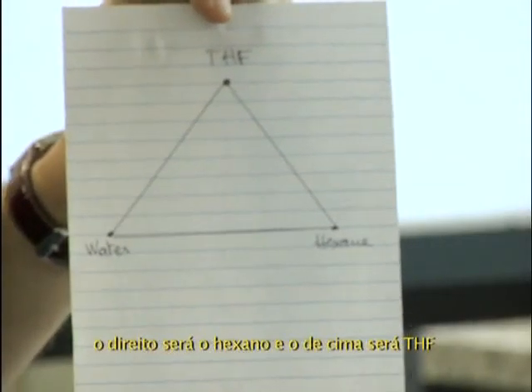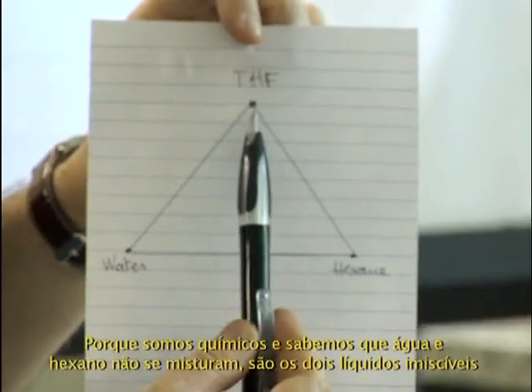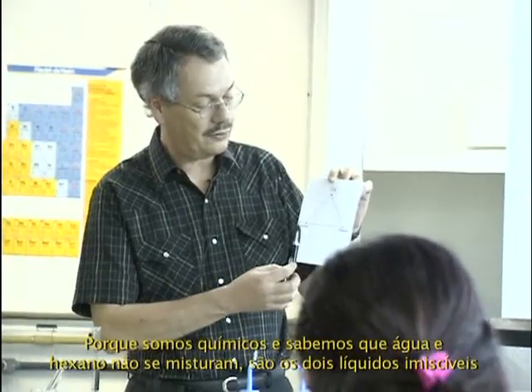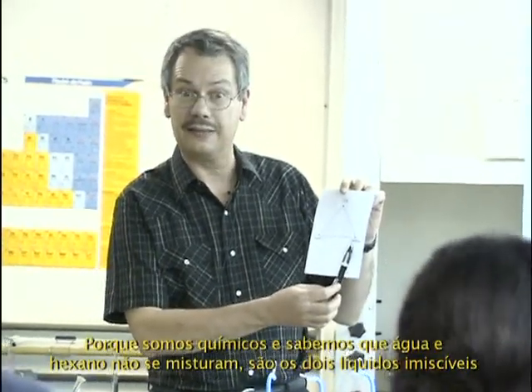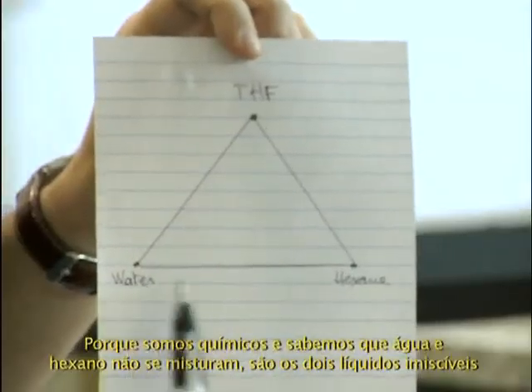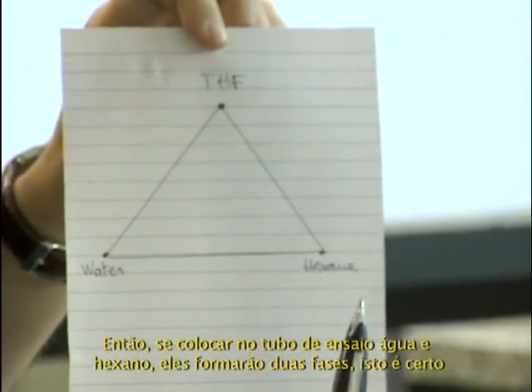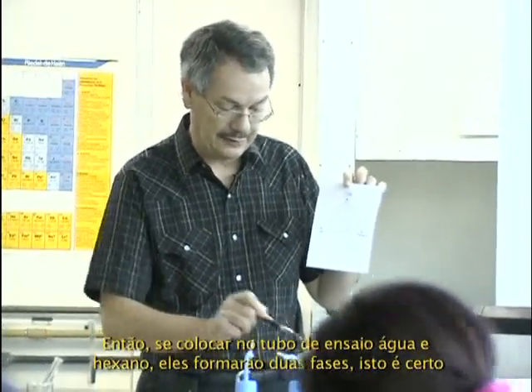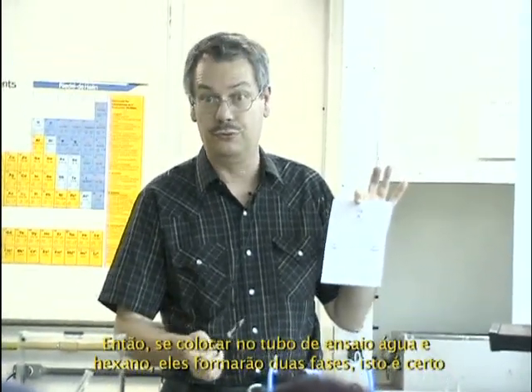THF. Why is that so? It's because we are chemists and we know that water and hexane are not miscible. That's the two immiscible liquids. So I know if I make in a test tube hexane and water, I will get two phases.